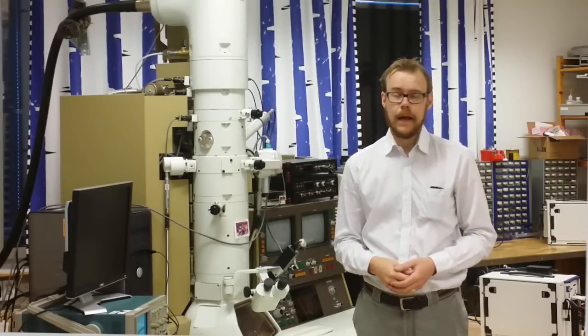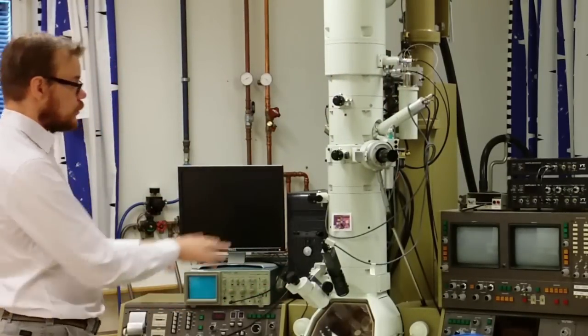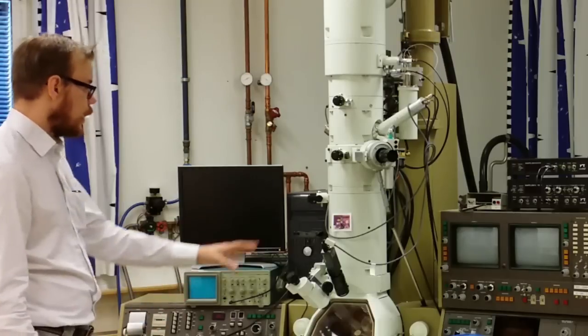Hi and welcome to the Transmission Electron Microscopy Lab. As you can see, the microscope contains a lot of different knobs and control panels.